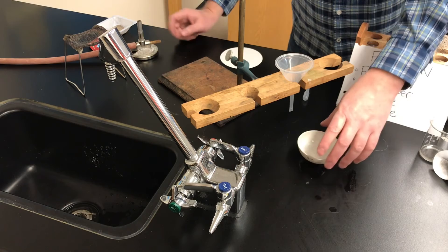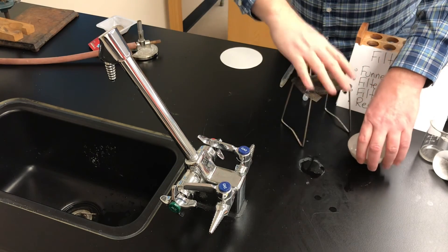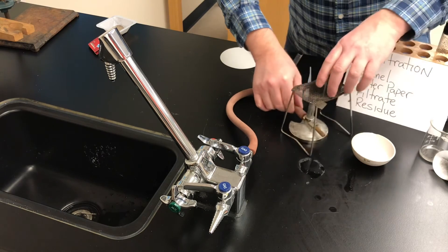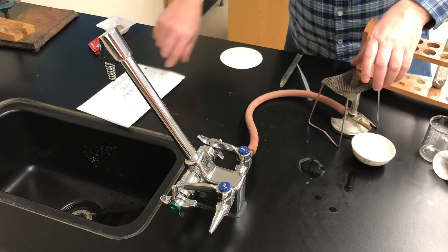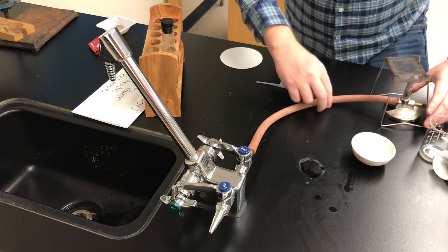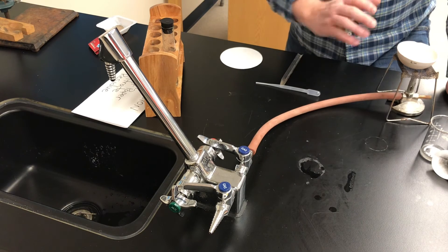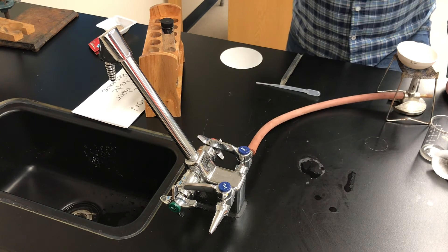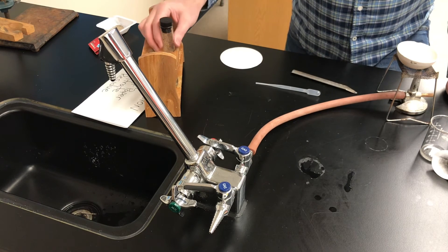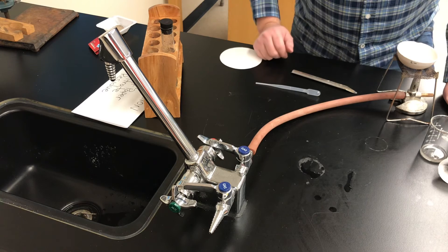So now we have pure charcoal and pure sand. What about the salt? The salt was in the filtrate — it's in the evaporating dish. That's why I used an evaporating dish — because we're going to evaporate. I'll take a wire stand and put the Bunsen burner underneath it. I'll put the evaporating dish over top, light the burner, and it's going to evaporate the water, leaving us with solid salt in the evaporating dish. We could then scoop that out into a watch glass or test tube.